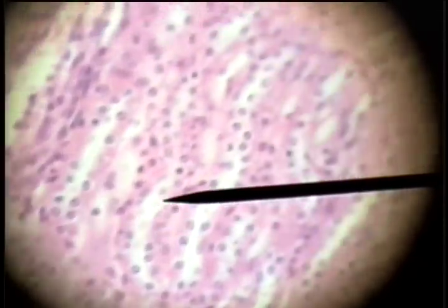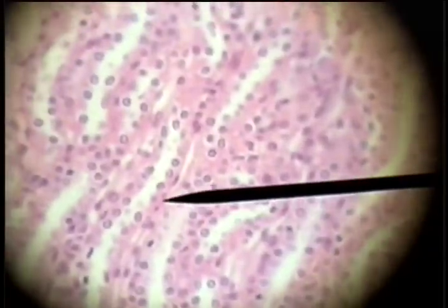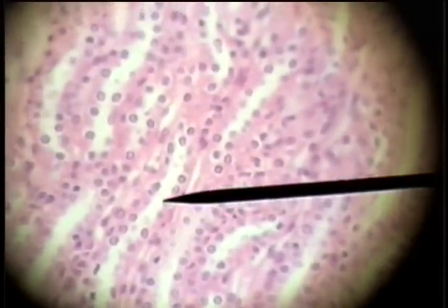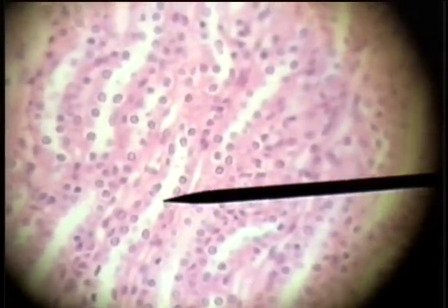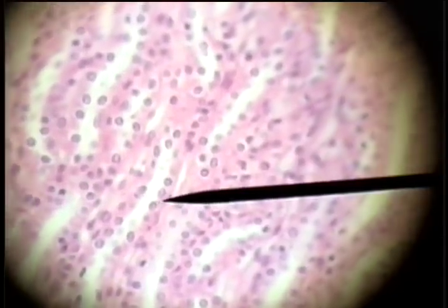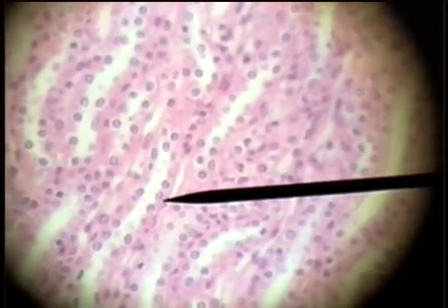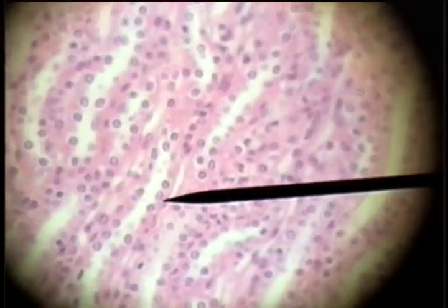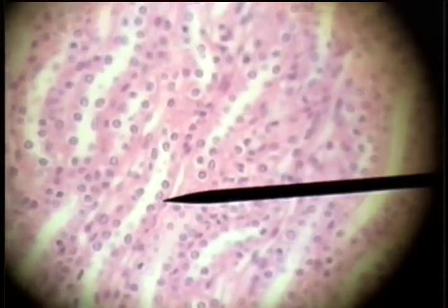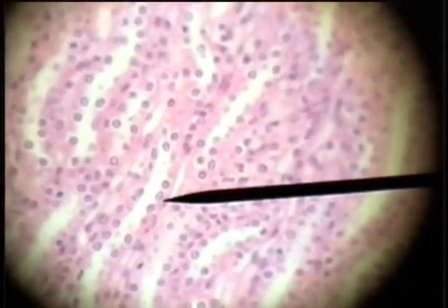These would be longitudinal cuts, and you can see the lining. This is the lumen or hollow center of the tube. Here's the cuboidal epithelium lining the wall of this tube in the kidney.